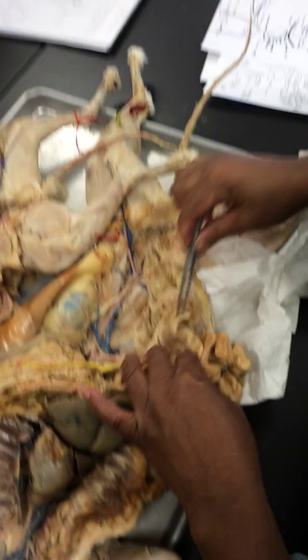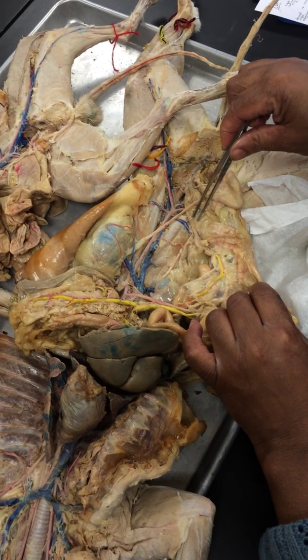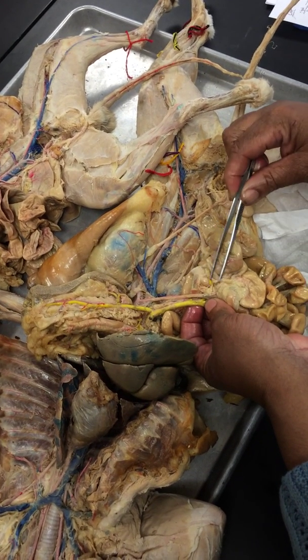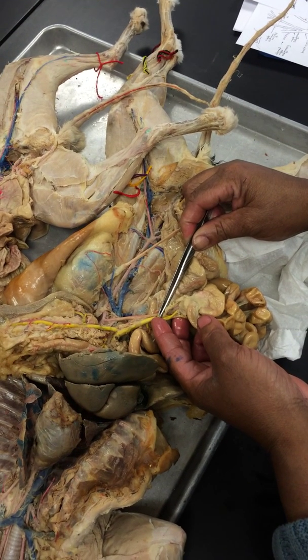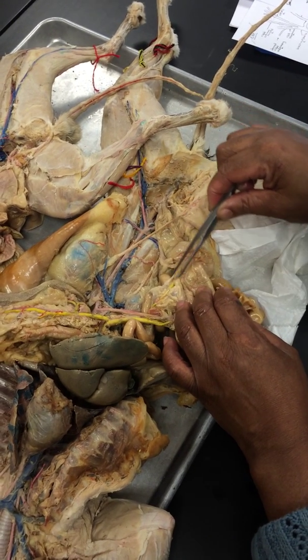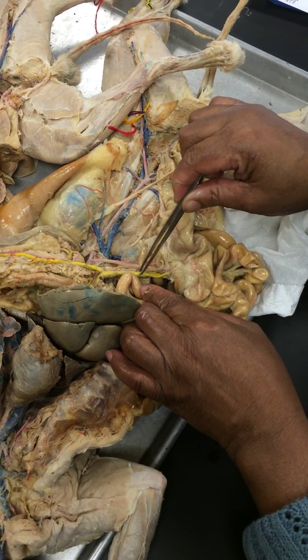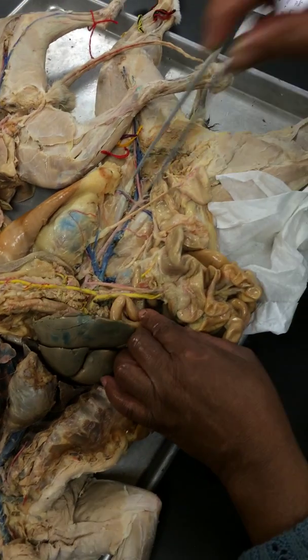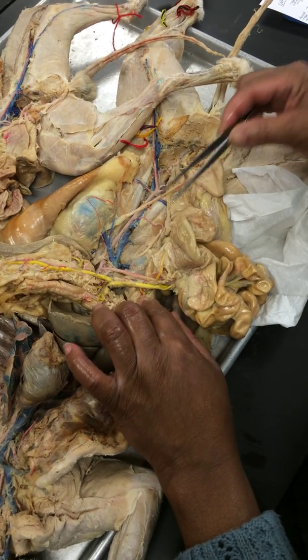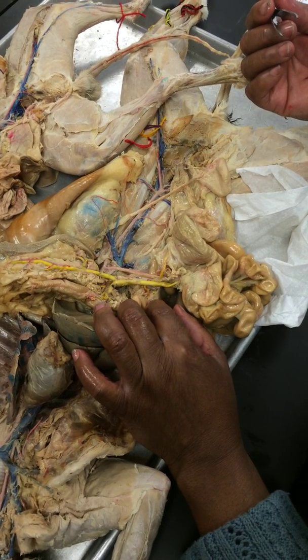Oh, forgot this one. This one that's running up the front of the large intestine, this is the large intestine. So this is the inferior mesentery, and it is supposed to empty also right here. It just got busted. It's supposed to empty into the superior mesentery. So if I was coming from the large intestine, I would take this one, inferior mesentery vein, superior mesentery vein, hepatic portal vein, because I would have to empty into this one first. I hope you see a pattern that the superior mesentery is kind of the big vein that collects from several places.